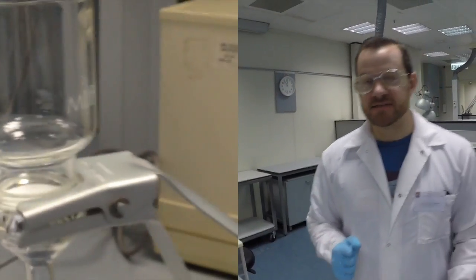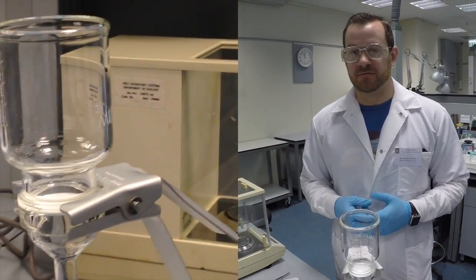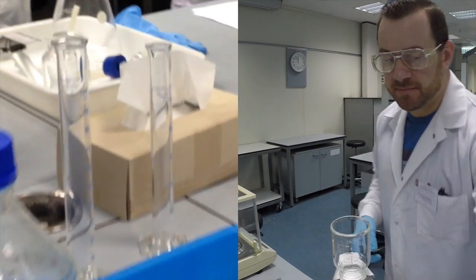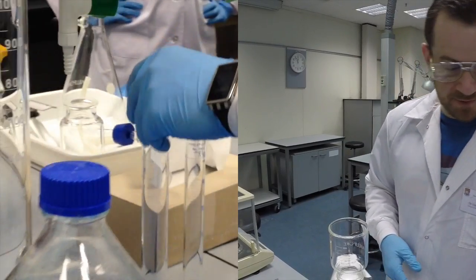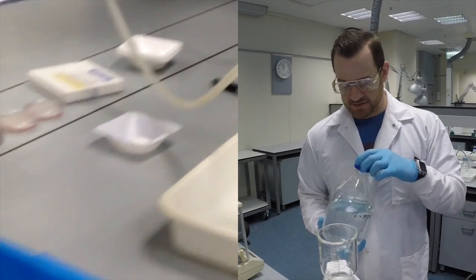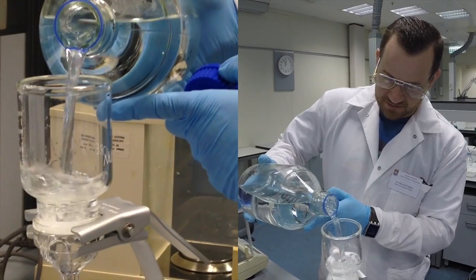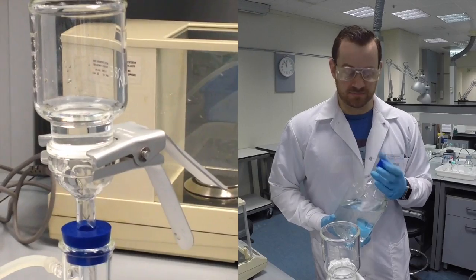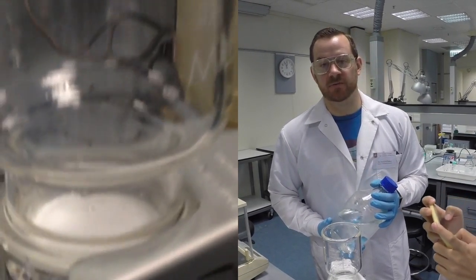Now for total suspended solids, you're going to be filtering 100 milliliters of liquid through this filter, and you want to be fairly precise, so you'll be measuring the volume using a graduated cylinder. But for the purpose of this demonstration, I'm just going to chuck some DI water in here so you can see what happens. So once I start adding my solution, it immediately is pulled through the flask by the vacuum. And when you have a very clean solution, it moves through the system very quickly.